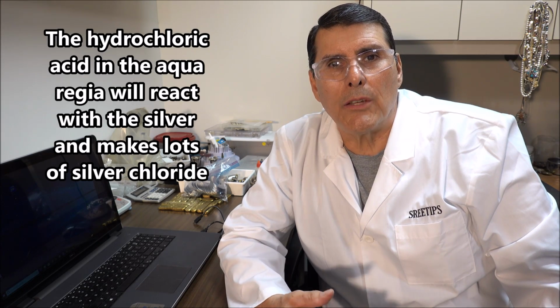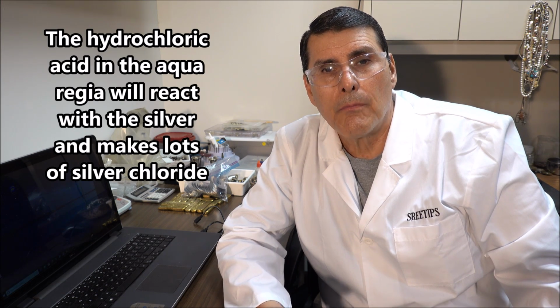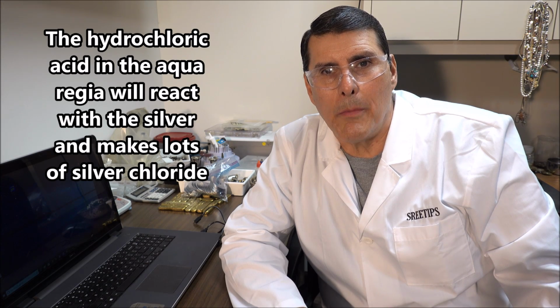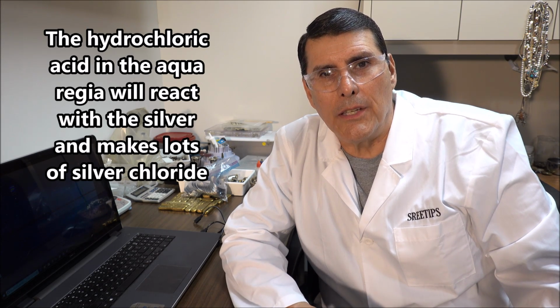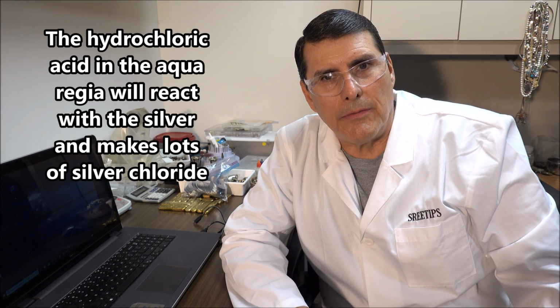Second problem is when I go to dissolve the gold after I've removed all those hot dilute nitric acid treatments, some of the solution will tend to cling to the gold. That solution will have silver in it. As soon as I try to dissolve that gold with the silver solution clinging to it, I'll get a bunch of silver chloride formation in my gold, which is undesirable because it will load the filters up, make filtering difficult, and silver chloride is somewhat soluble in these solutions.